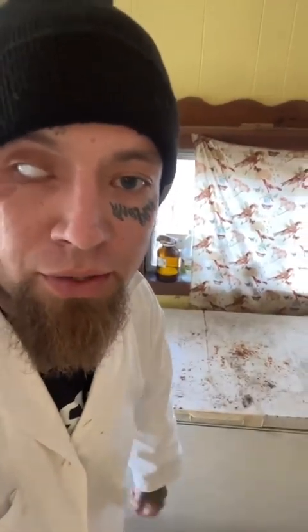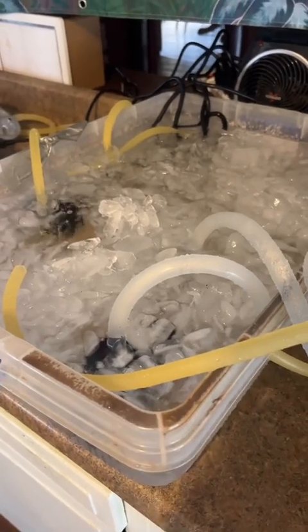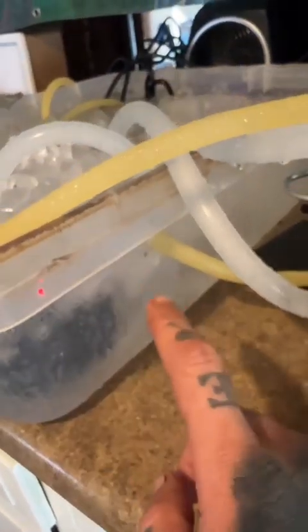You're going to go through an absolute ton of ice. I recommend getting a deep freezer — you can fill up a 5-gallon bucket, put it in there for two days, and you'll have a big brick of ice. Set that brick in here to melt, drill a spillway, cover it with vacuum grease so it doesn't leak, and run it to your sink.